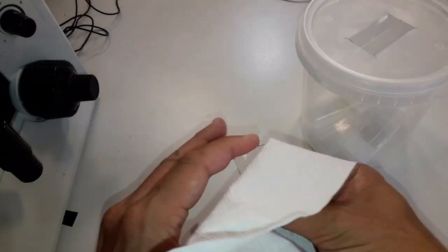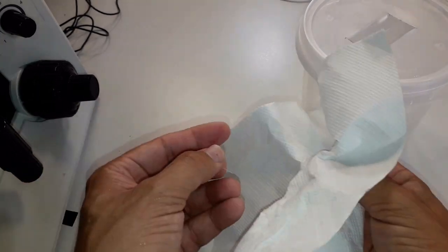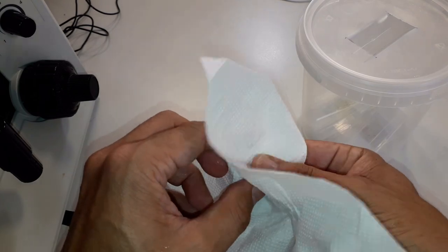One important thing when you wash them is that you really rinse them very carefully and thoroughly, because you do not want any detergent or soap left on the slide. Some water organisms are really sensitive, and even a small amount of soap might not be good for them. But generally if you rinse with warm water and dry wipe using tissue paper, you'll be fine.